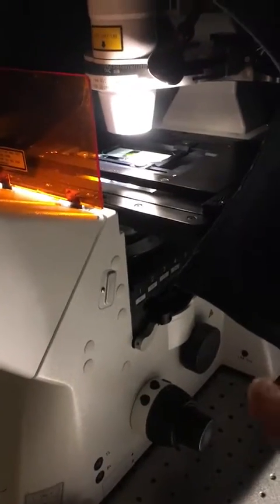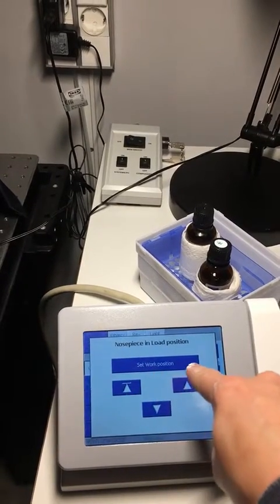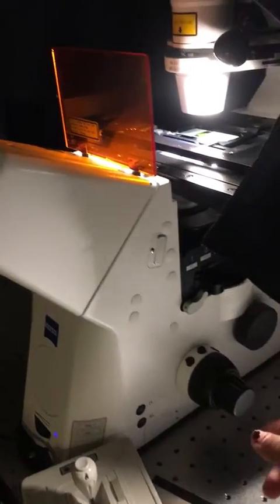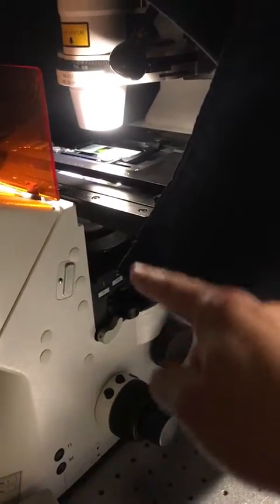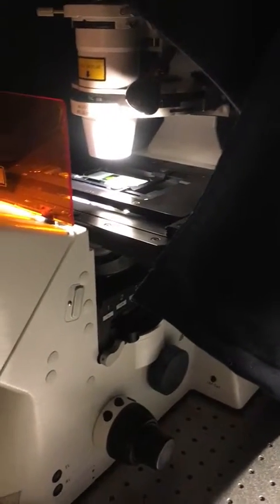The work position can be adjusted for samples of different thicknesses. For this you need to click on the load position, and you will see that the set work position button becomes active. To set the new work position, you need to look at the oculars and focus on your sample by changing the focus knob position. When you are satisfied with the focal plane and you want to image it later, you click on set work position. The software will remember the position of the stage which corresponds to your focal plane, and then when you mount new samples, it will focus on exactly the same plane.